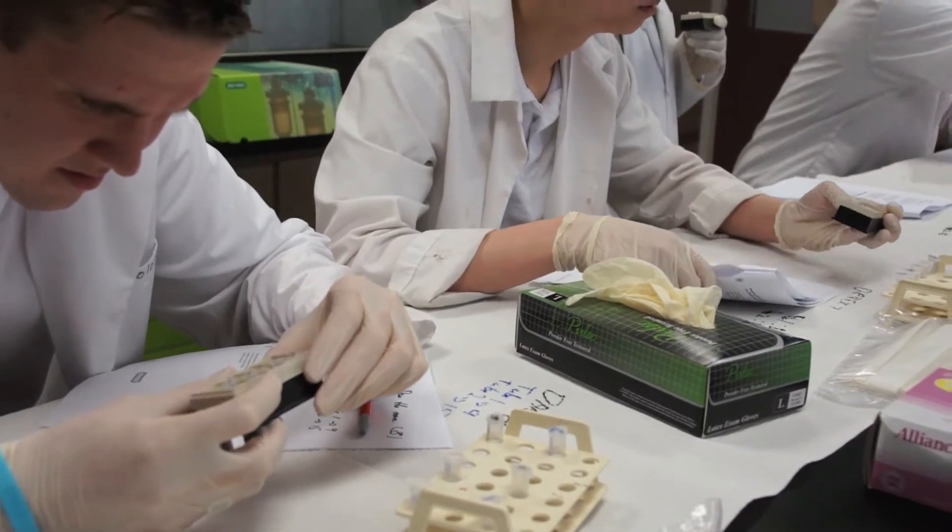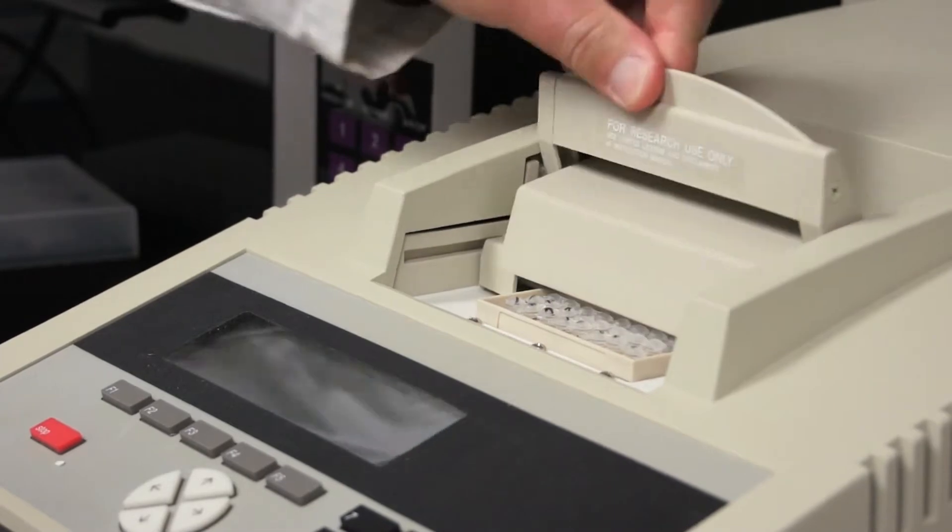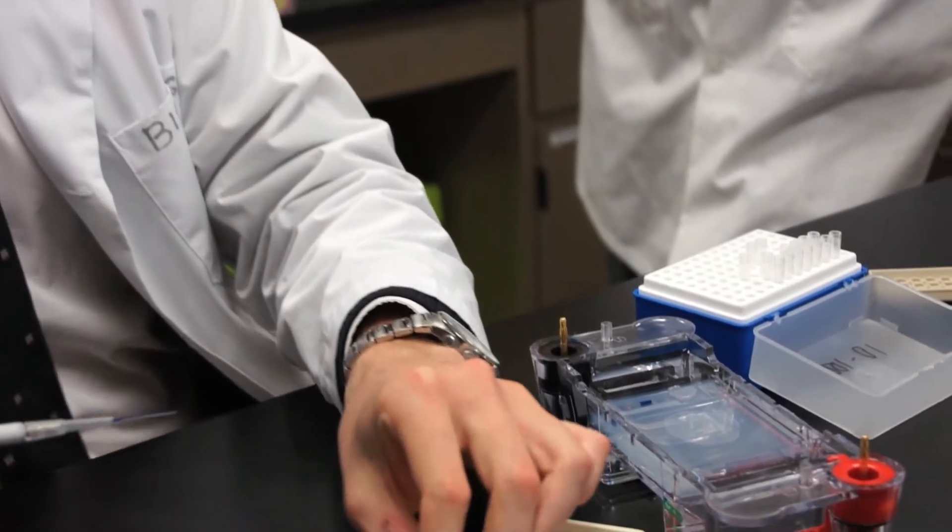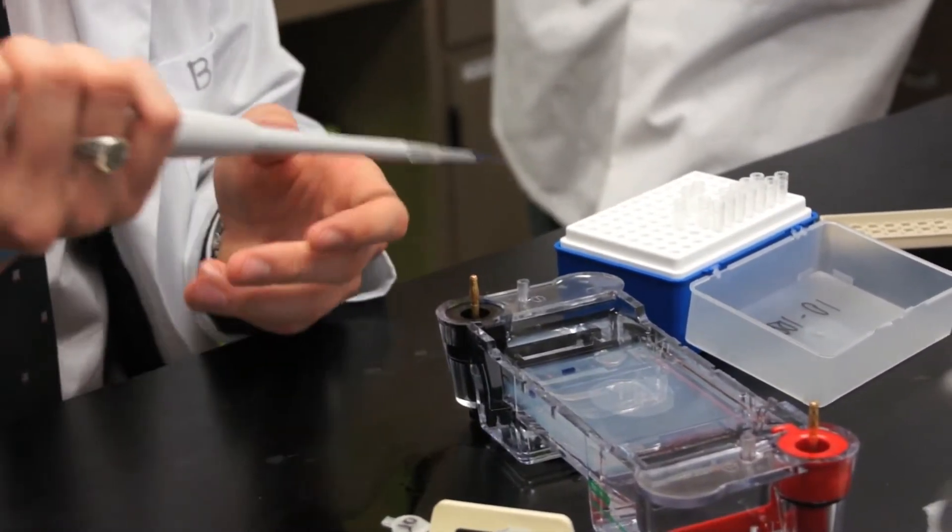So what we did is we broke the cell apart and through several processes we flushed out everything in the cell that was not DNA so we pretty much ended up with only DNA samples.